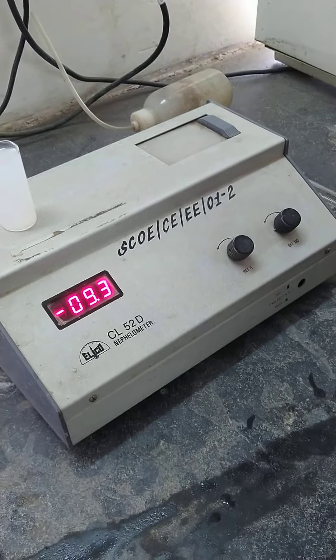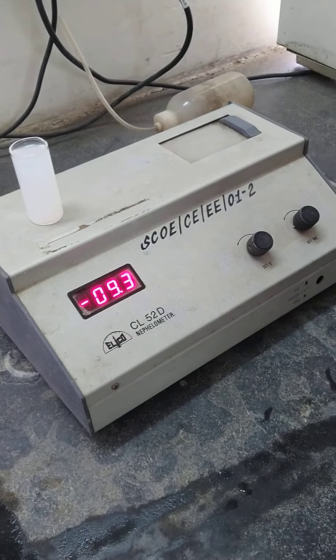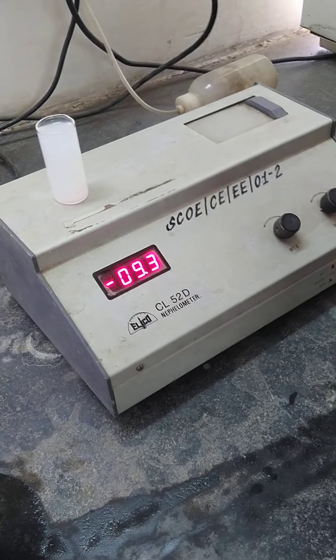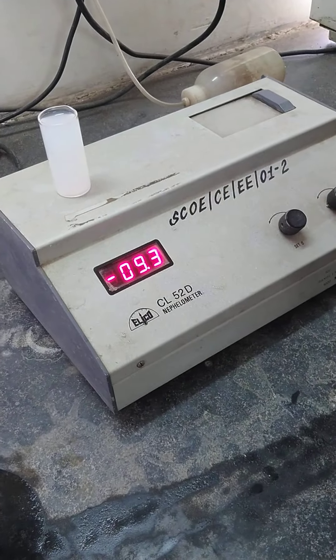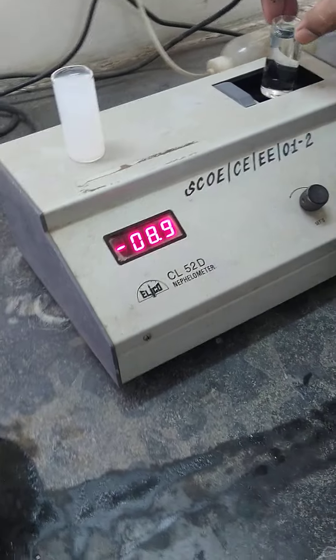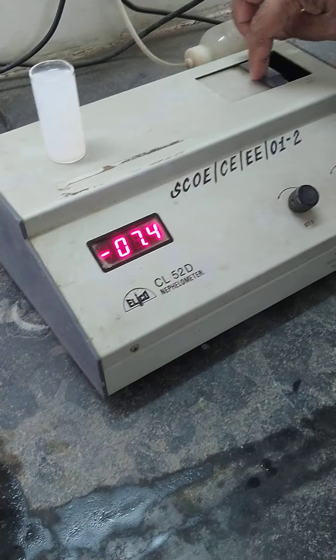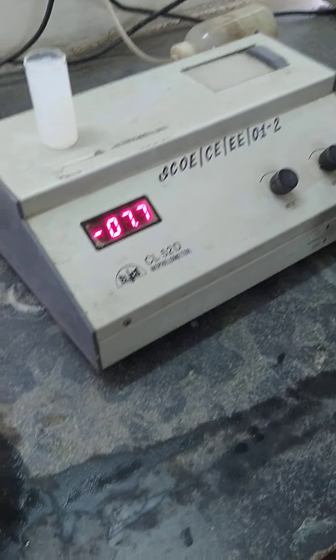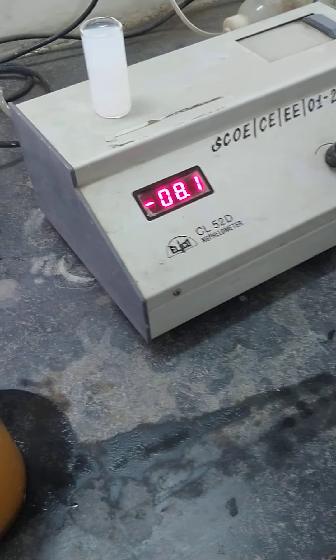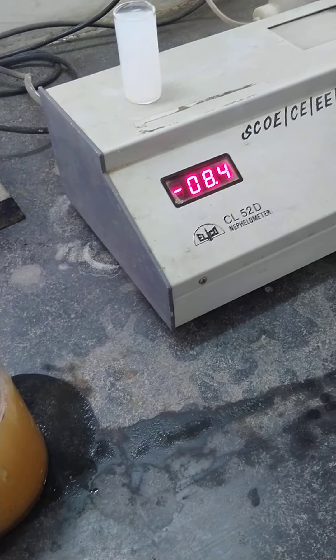When we use the distilled water, we have to set it to zero turbidity. So we are putting the distilled water in the slit and we will adjust it to zero.